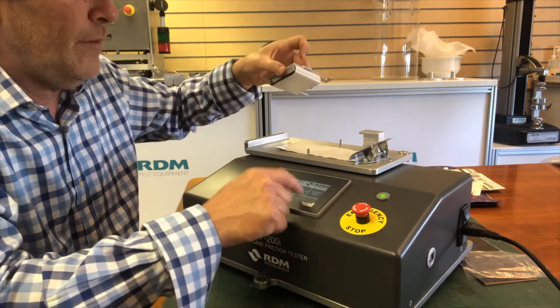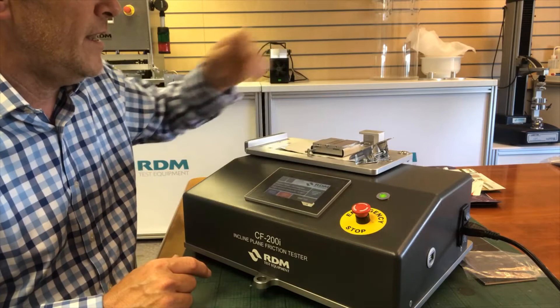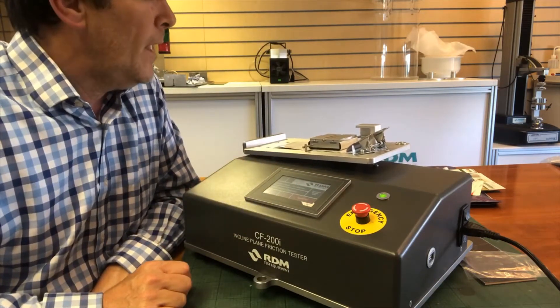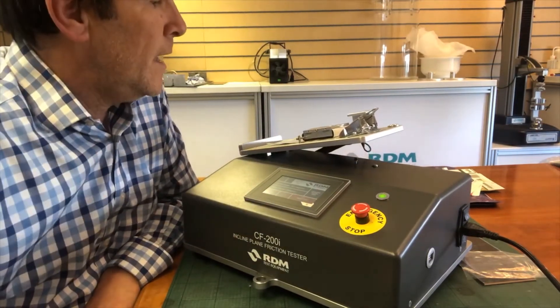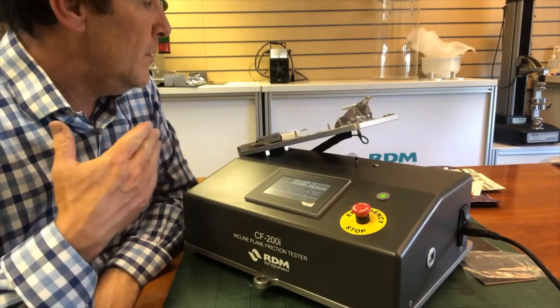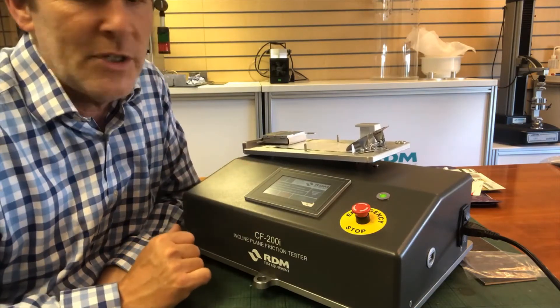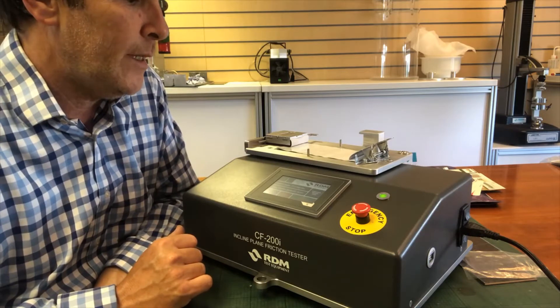At the moment, if I press start nothing will happen, but as soon as I put the sled down it sees the sled and we can start the test. The incline plane base starts to rise and the angle at which the sled slides is measured. In this case it was 17.3 degrees, which resolves to a static friction value of 0.311.